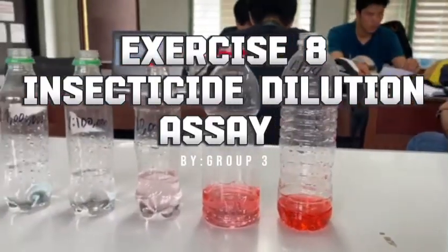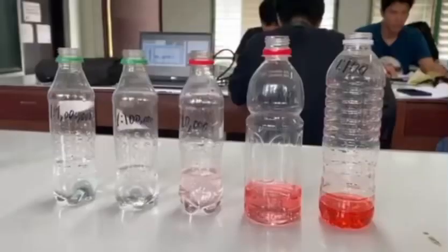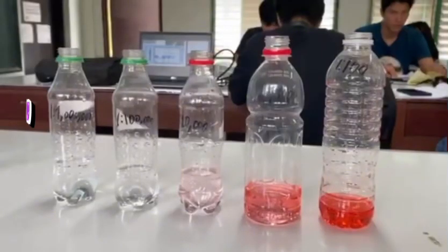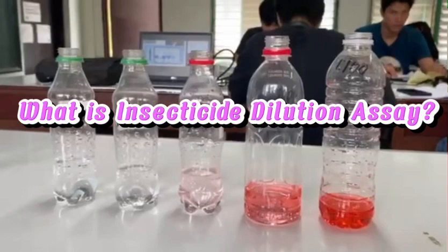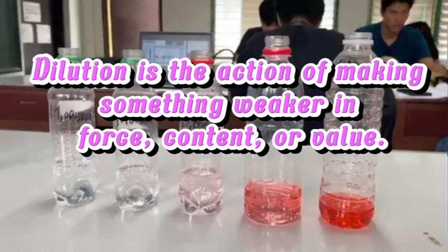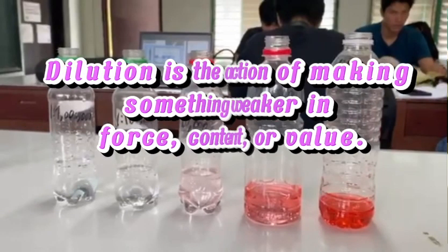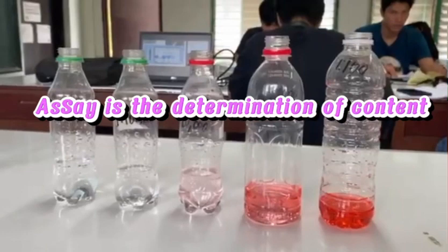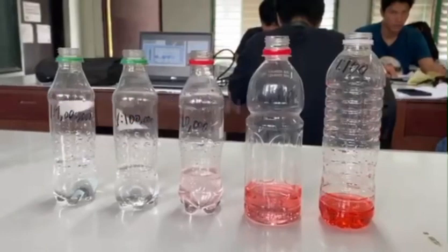Today, we will demonstrate insecticide dilution assay. But first, we need to know what is insecticide dilution assay. Dilution is the action of making something weaker in force, content, or value. Assay is the determination of the content.